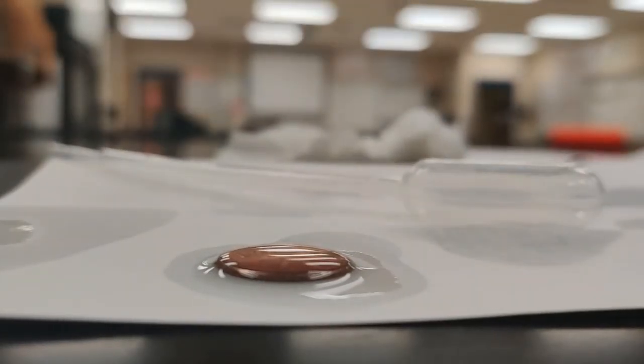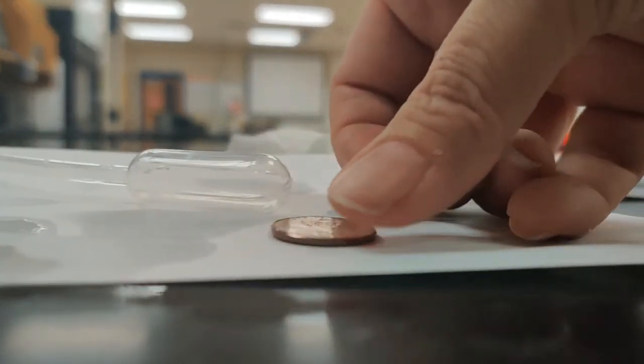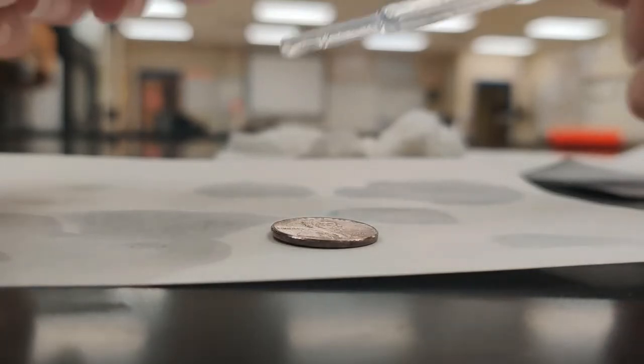So trial 4 was 18, which is pretty consistent with trial 2 and trial 1. Actually not too far off any of the other ones really. And now we have one more trial to do, trial 5 with our methanol. And then we can average all of our data and see if we can spot any trends.